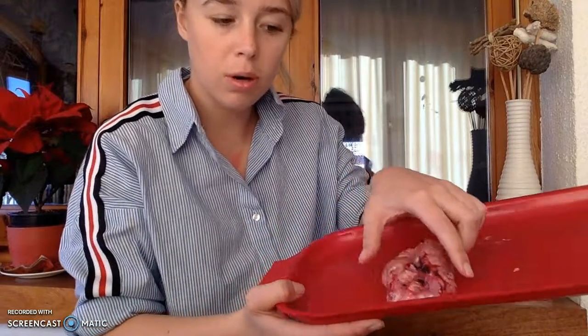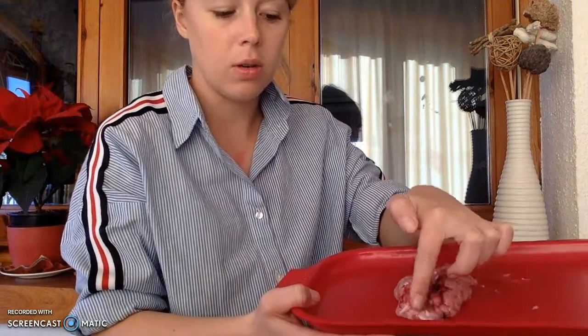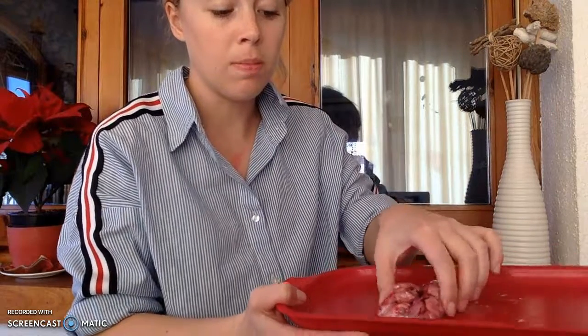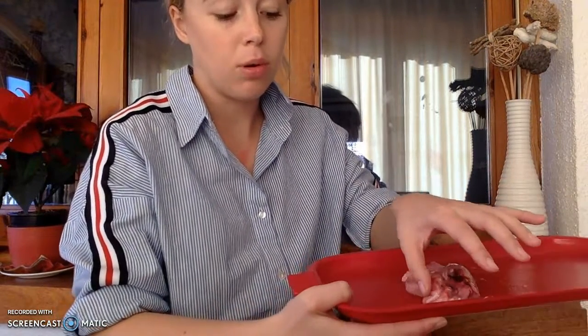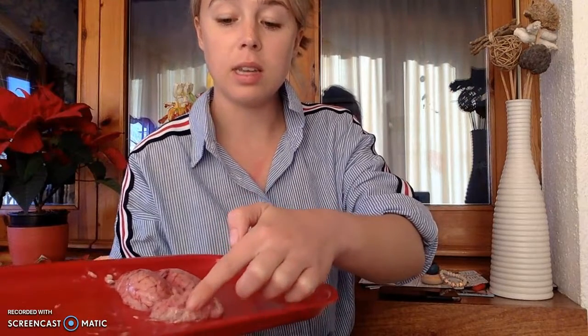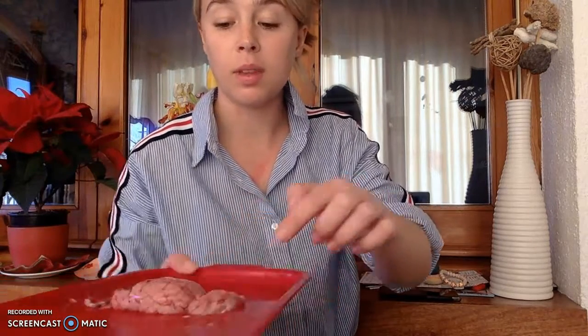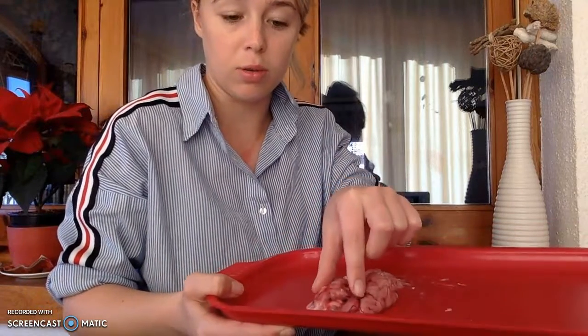So this frontal part of the brain right here, this is our frontal lobe. The parietal lobes are where my fingers are right here. Temporal lobes are right here and right here. And then the occipital lobe, this is the back now, is right here. And this is our cerebellum. Now, this whole pink matter that we see all covering throughout the brain, this is our cerebral cortex.